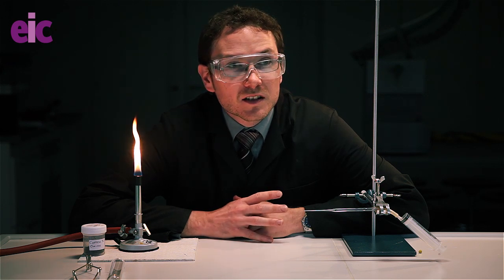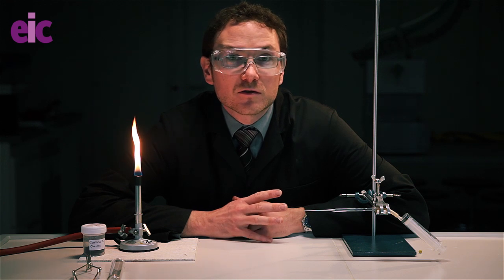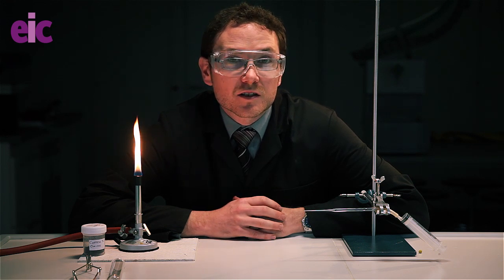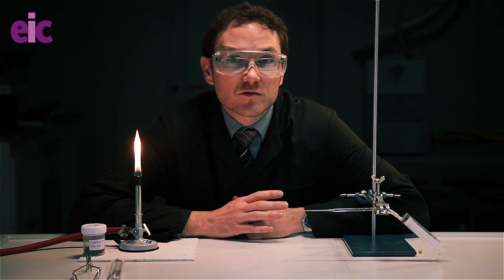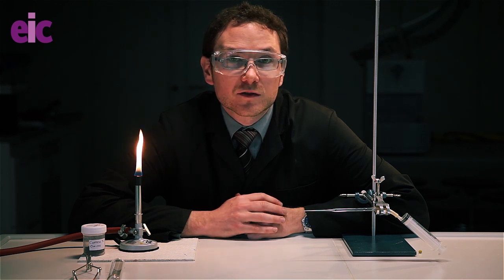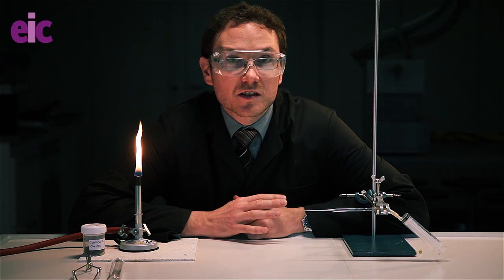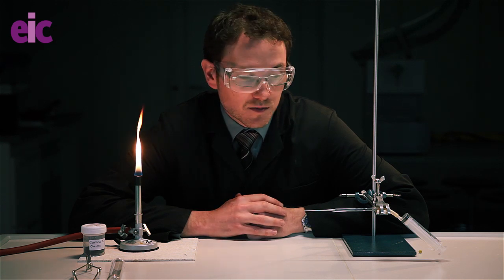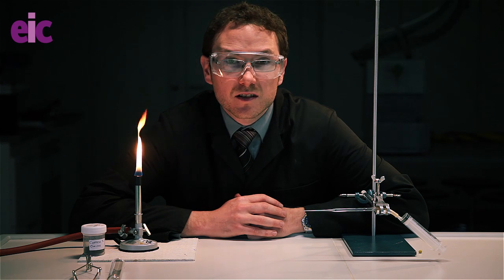The problem with doing the classic old-school version of the copper oxide reduction is that it tends to be fairly dangerous. You've got a reasonably large volume of hydrogen and oxygen that potentially could combine and produce a hazardous explosion, and there have been accidents in the past.